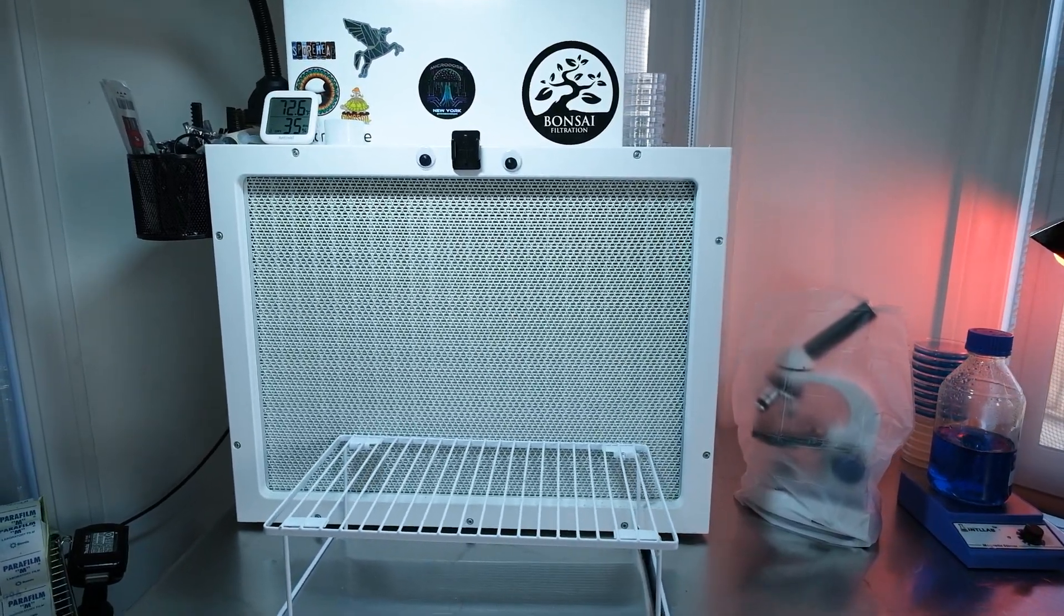Okay, so first you're going to need at least a still air box, if not a flow hood, to accomplish this with any degree of success. There's a ton of great still air box how-to videos on YouTube. I'll link a couple in the comments for you guys. Let me know if you want me to do one—I will, I'll make one and film it for you guys if you want me to.